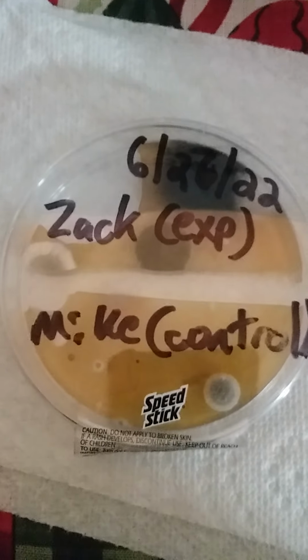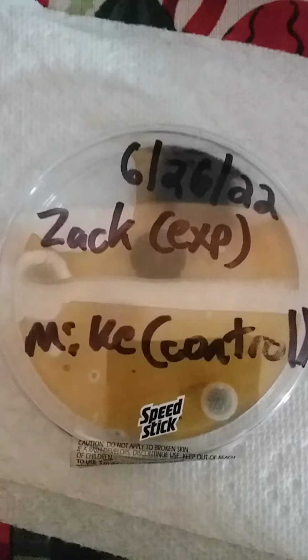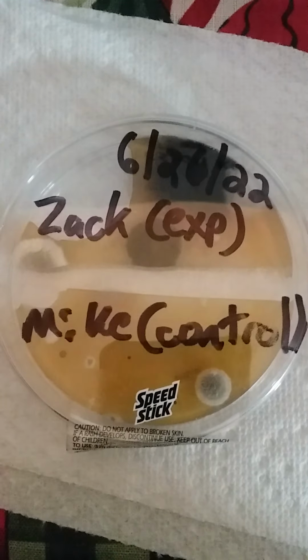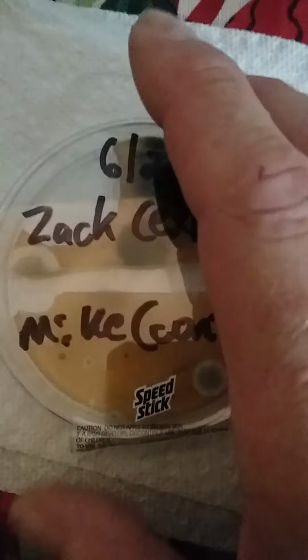Okay. That looks kind of clear. You'll see Zach is the experimental side, and Mike, that's obviously me, is the control side. This was done on June the 26th, and that makes 8 days since this was started. So let's see what it looks like.